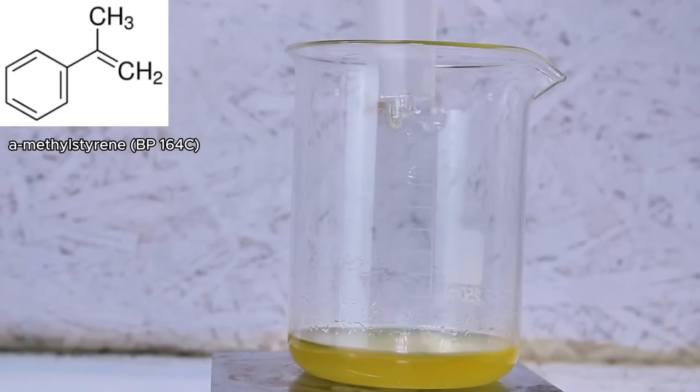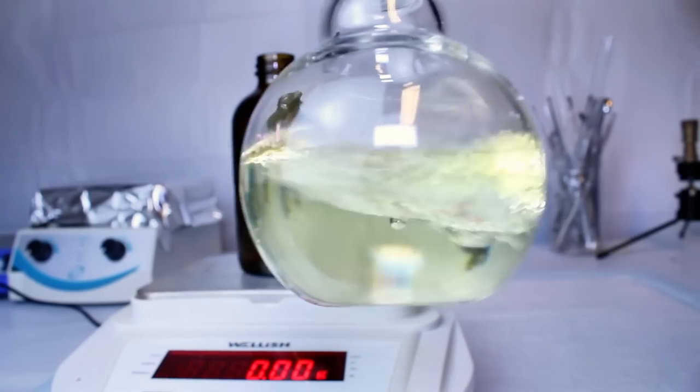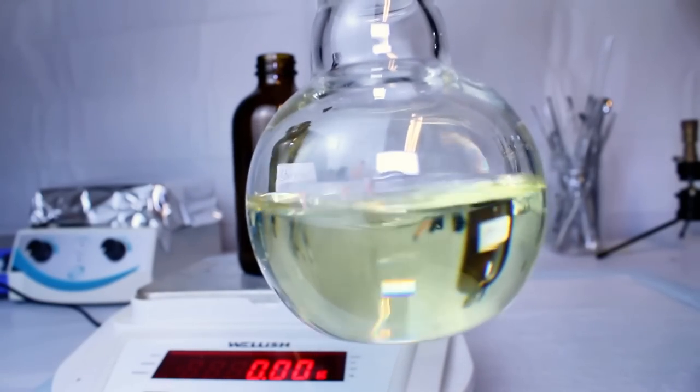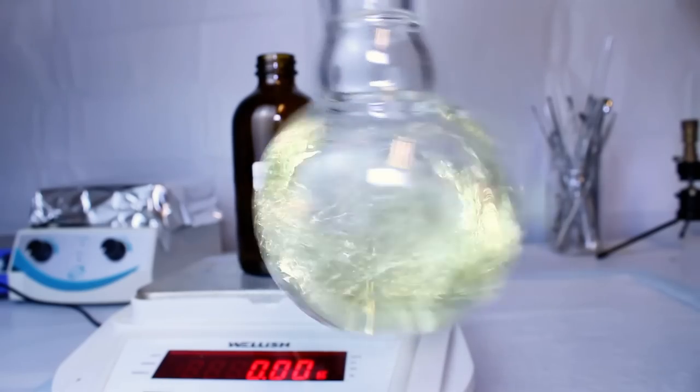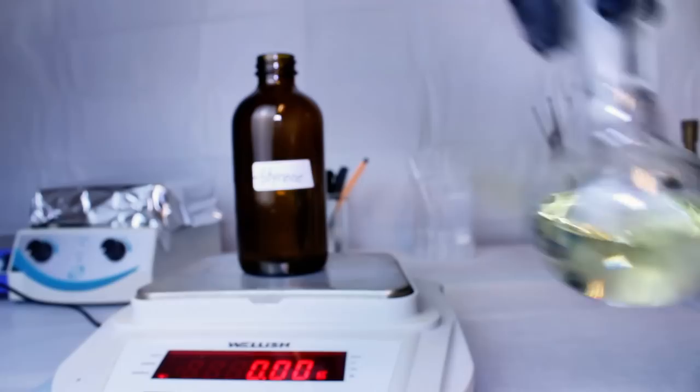And now at this point, I'm finally done, and I'm left with a pretty good yield of mostly pure styrene. I have no idea how to calculate a percent yield on this, so I'm not going to try, but when I do store this, I want to store it in a brown glass bottle and in a cool, dark place.